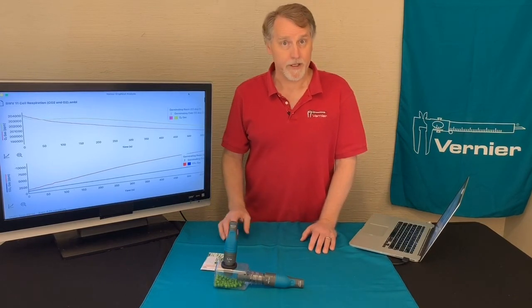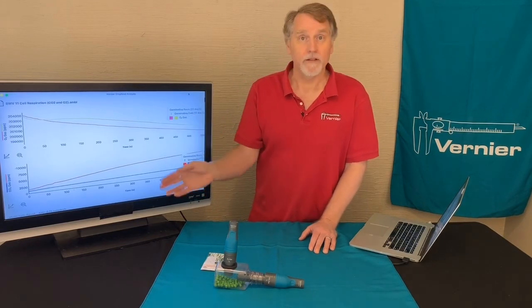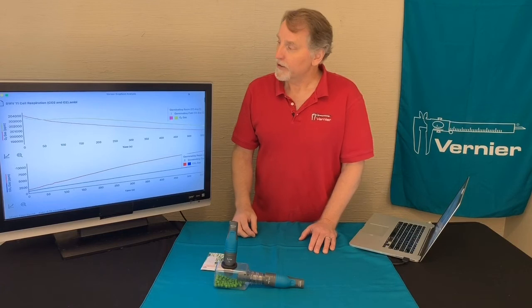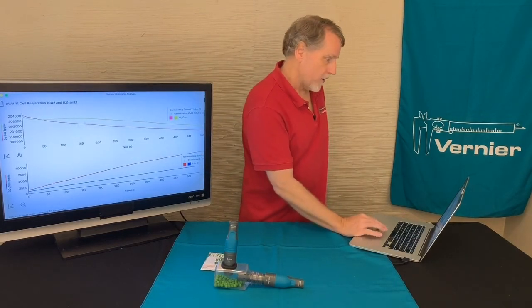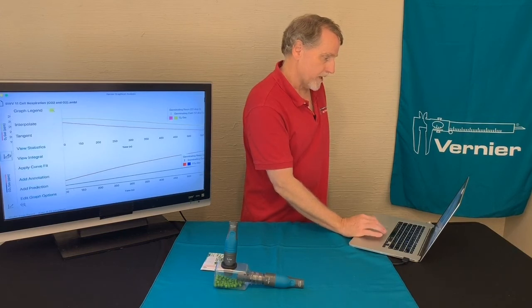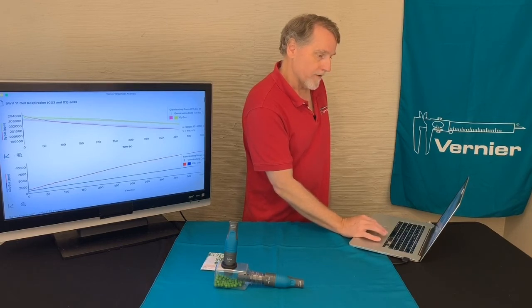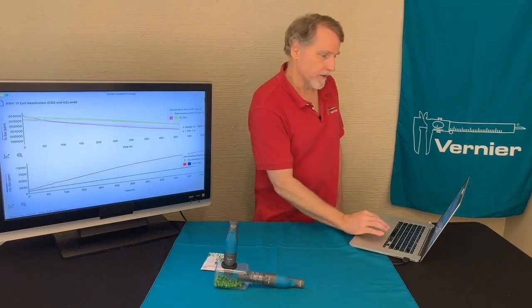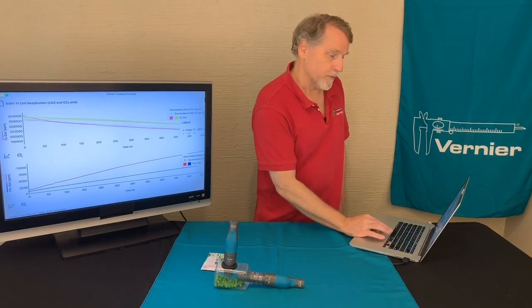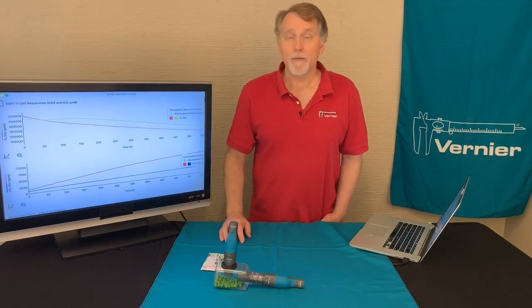To do the investigation, what they want you to do is maybe look at what's happening to the rate of these levels of the gases inside there. To do that, we have our graphical analysis software. And if I go up to the upper graph, I could come here and maybe I apply a curve fit. And it tells me something about the slope of that line, gives me something about the rate of respiration, and that could be very important. And so in this experiment, you analyze this data to see what's happening with cell respiration.